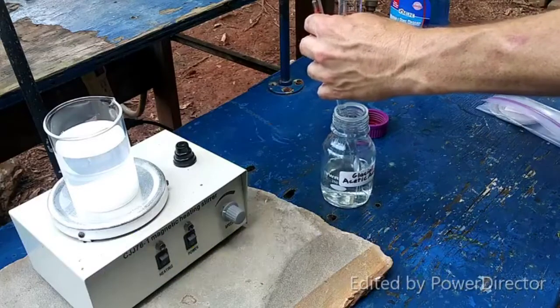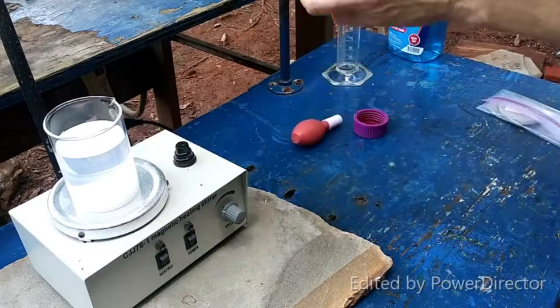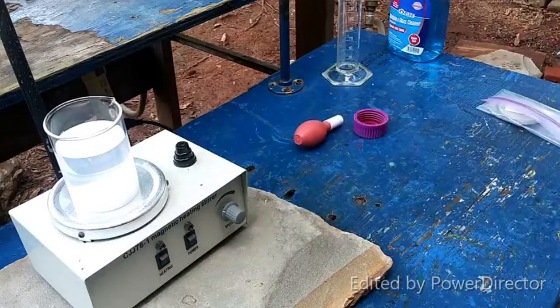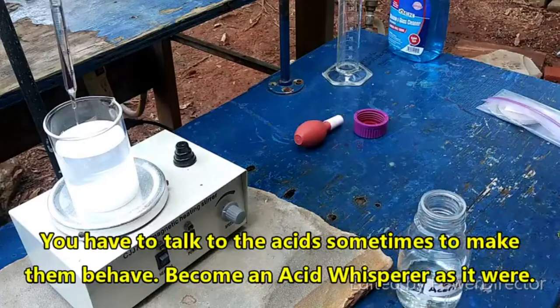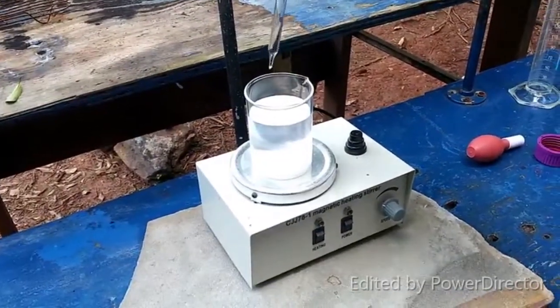Let me tell you what we're doing here. You are going to stop being a pain in the ass. There we go. 5 ml. Alright, stupid bulb.